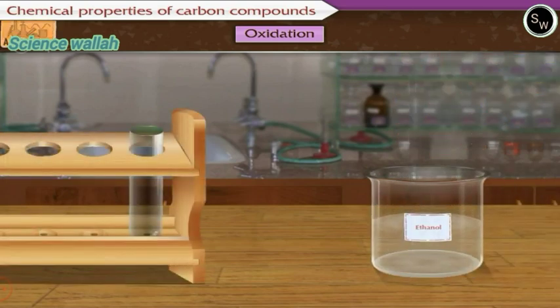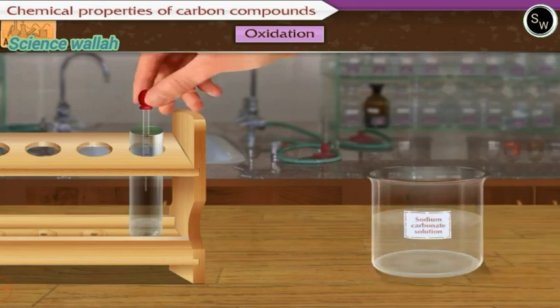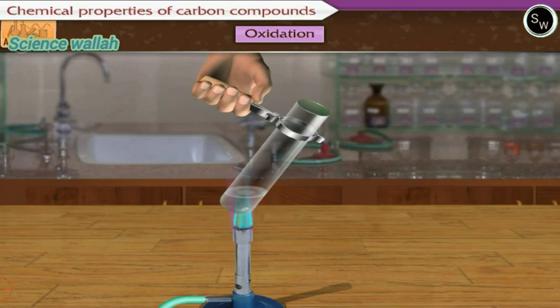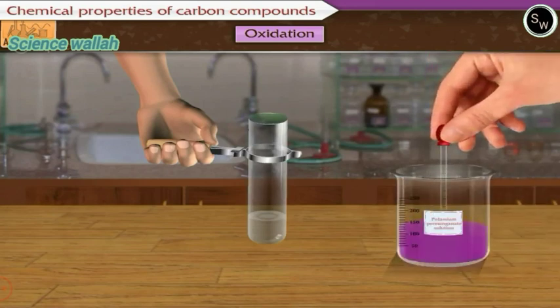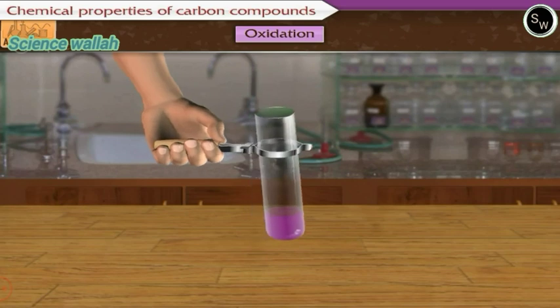First, let us take 2 to 3 ml ethanol in a test tube and add 5 ml sodium carbonate solution in it. Now let us hold the test tube on the burner and warm the mixture. Now in this warm mixture, let us keep on adding dilute solution of potassium permanganate drop by drop by means of a dropper and shake the test tube.